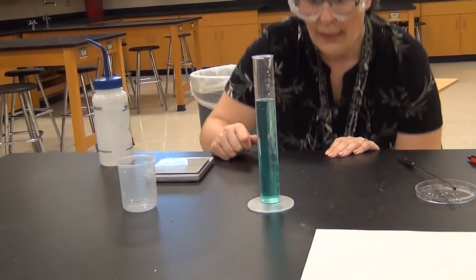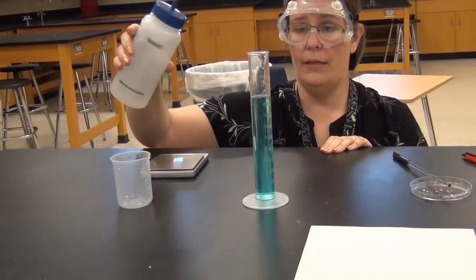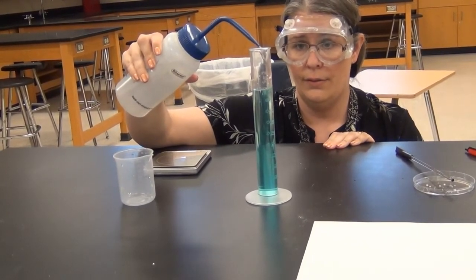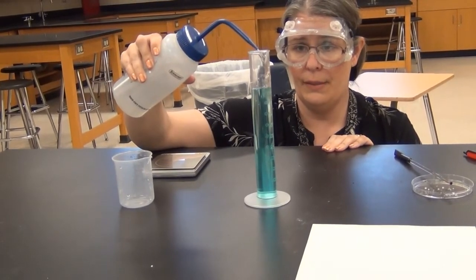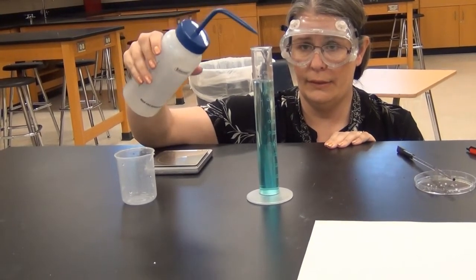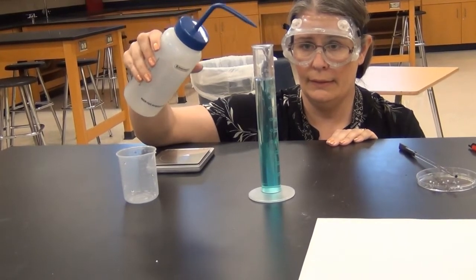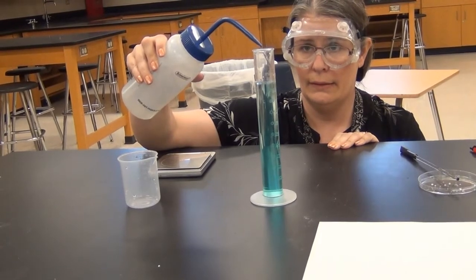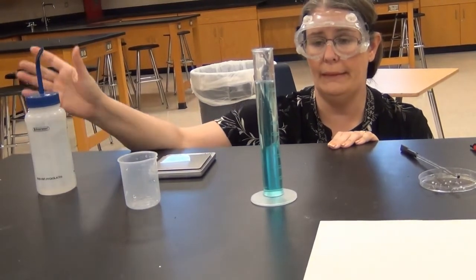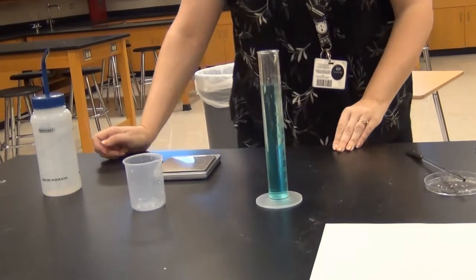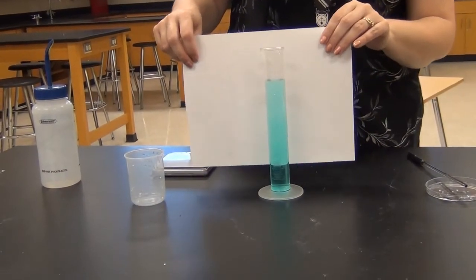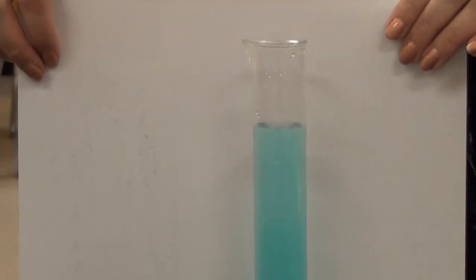Now I'm going to get down to eye level so I can read the graduated cylinder correctly. I'll just use the squirt bottle here because I don't need a ton to fill it all the way up exactly to the 100 milliliter line. I'll be very careful as I get close to the end so I don't overfill this. Just a tiny bit more. This might be a good spot to use a dropper if needed. So now I have 100 milliliters of solution right at 100.